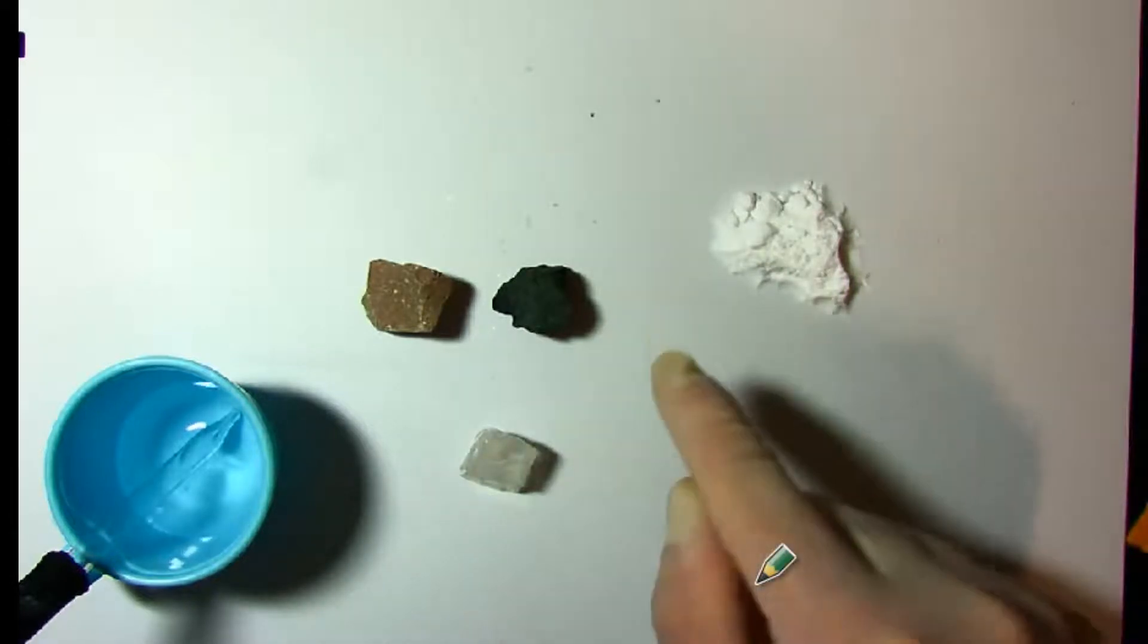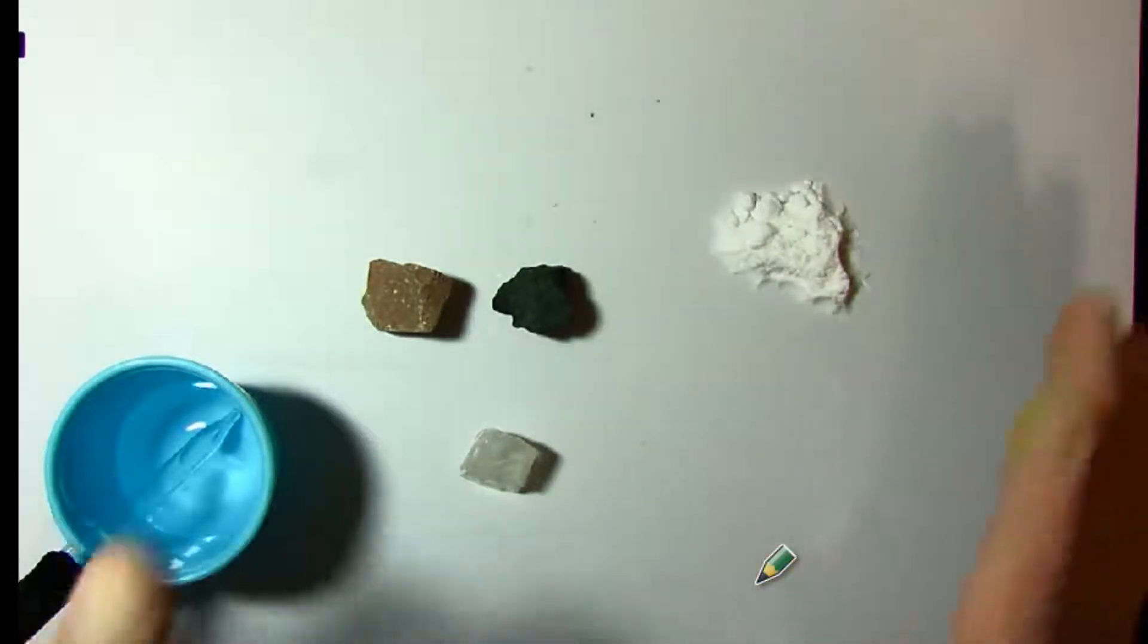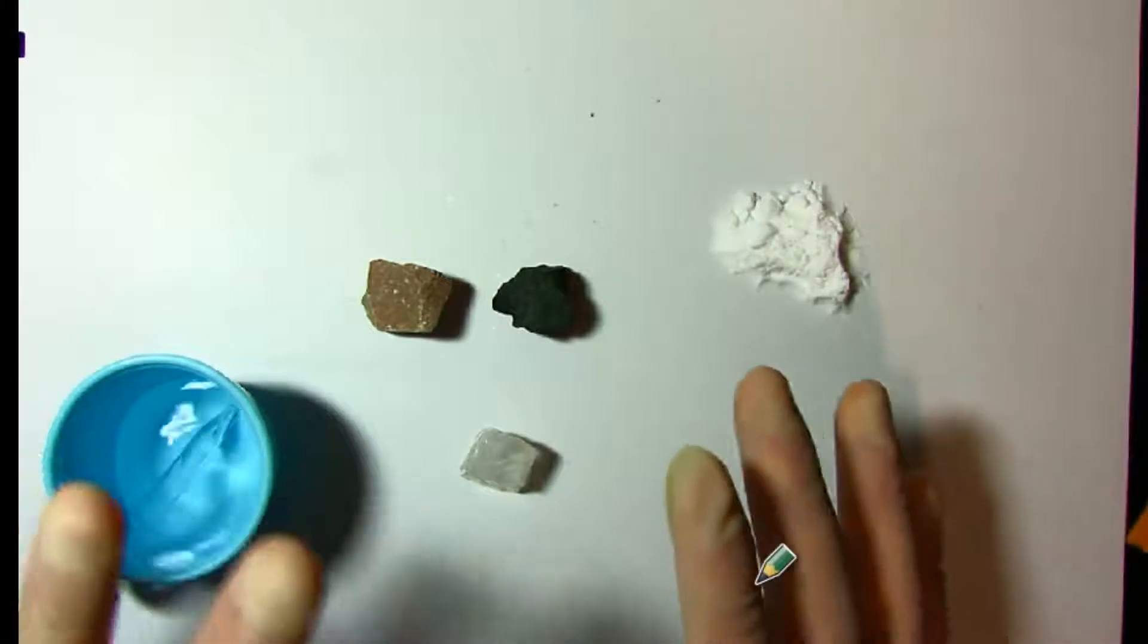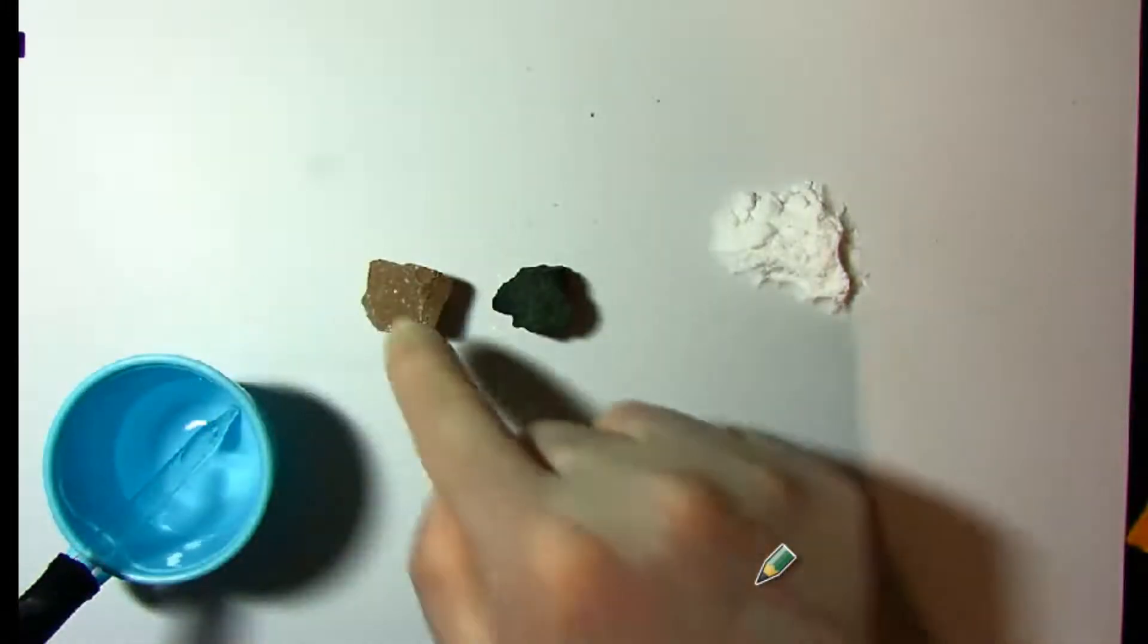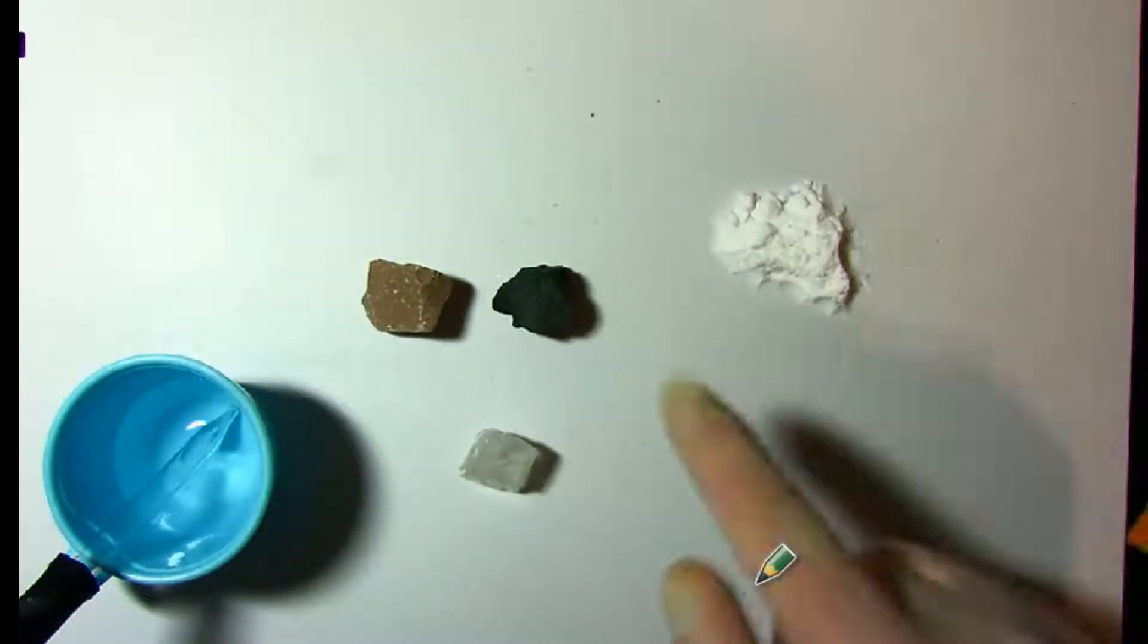We're going to be testing rocks for carbonates. Wait a minute, Mr. Malham, what do you mean here? Hold on, you just said carbonates are in bones. Are you telling me these rocks can possibly also have carbonates in them?